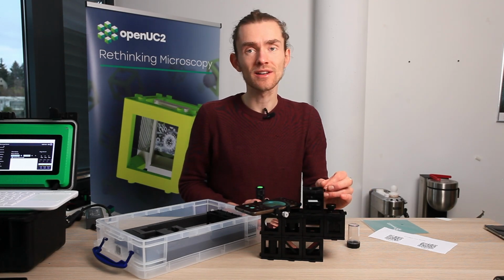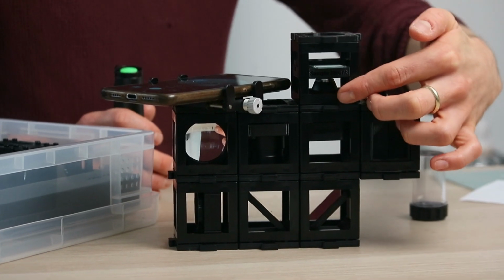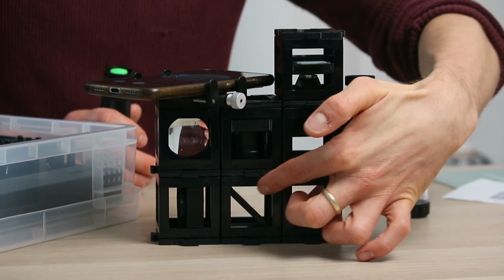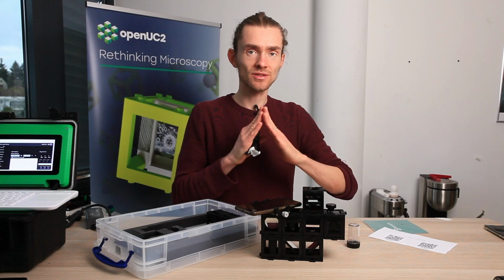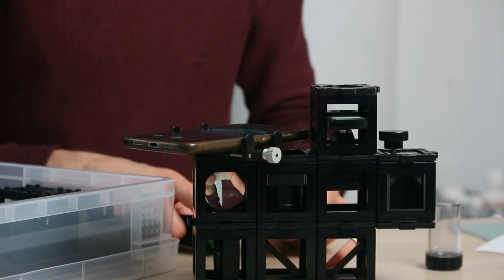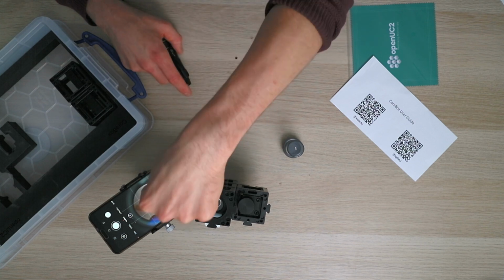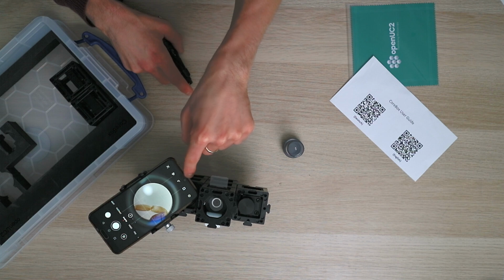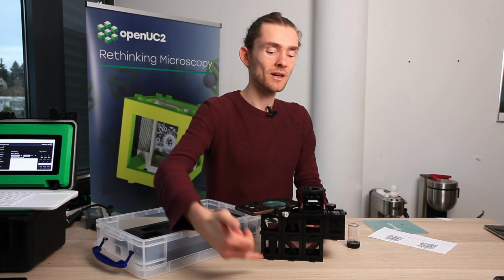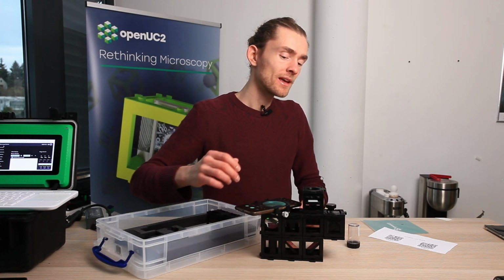So it's very similar to the telescope essentially. So the first lens here, the objective lens, has a rather small focal length, and it will form an image somewhere in that position here. And it comes out at a certain angle, and the second lens here acts as the second lens in a telescope, and essentially the ratio between the two lenses determines roughly the magnification. And then the third lens in the camera of our smartphone is basically just re-imaging what's coming from infinity to the sensor. And so the magnification roughly is determined by the ratio between the two focal lengths of the two lenses here.